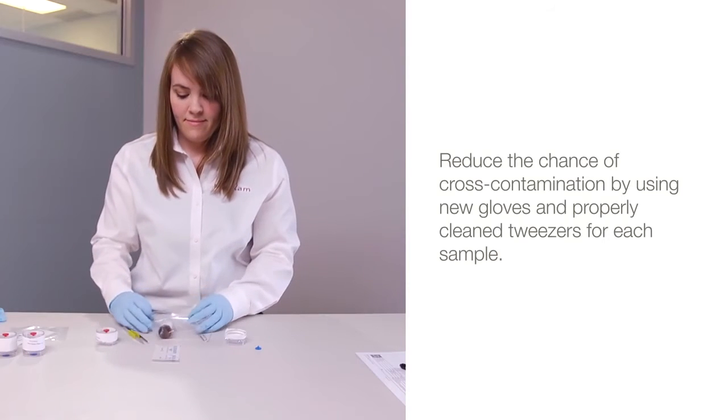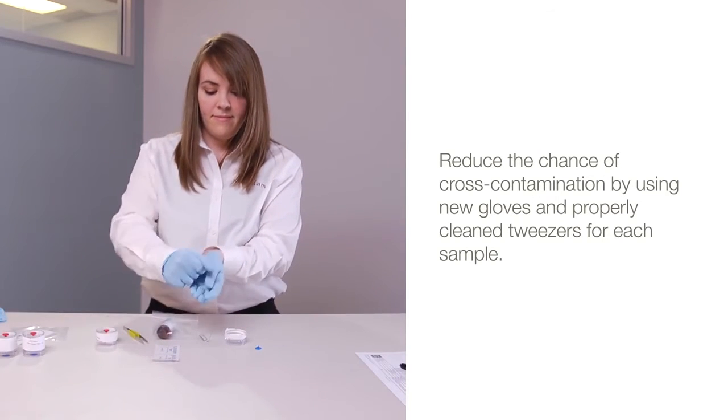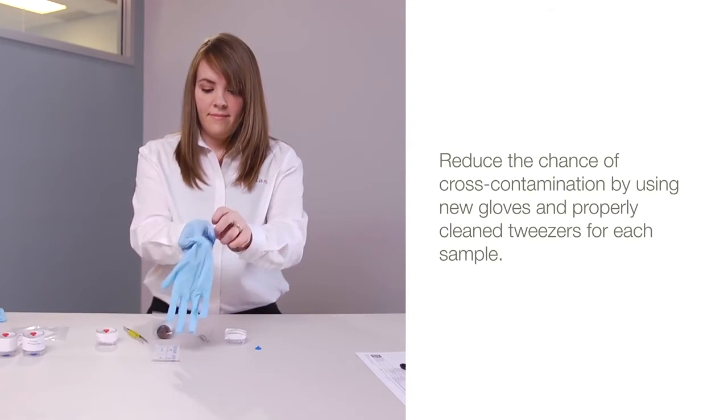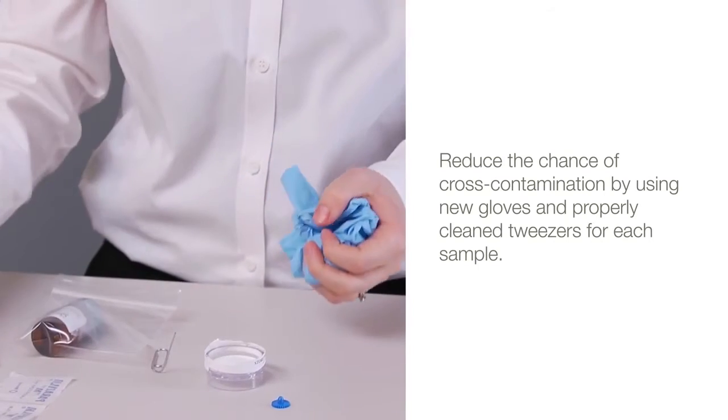If stabilizing multiple samples, you can reduce the chance of cross-contamination by using new gloves and properly clean tweezers for each sample.